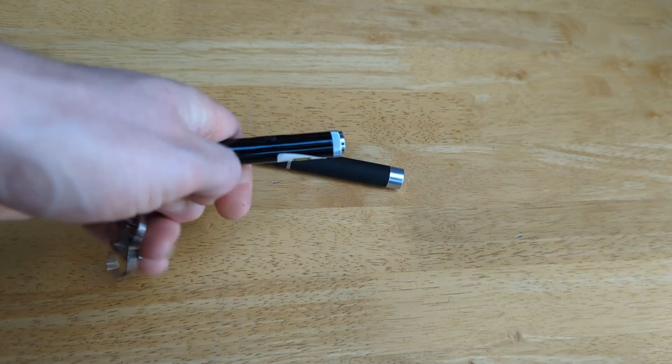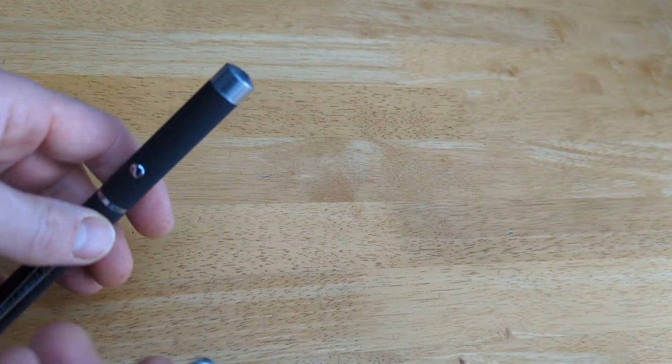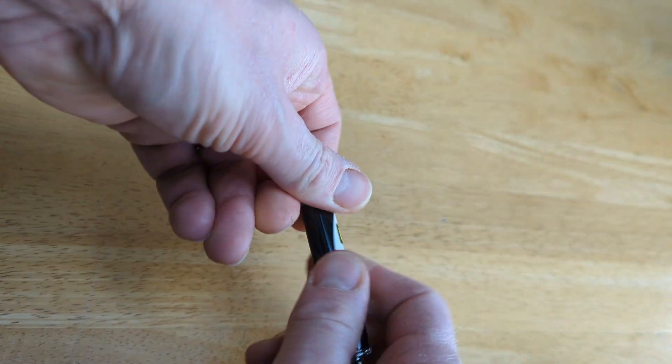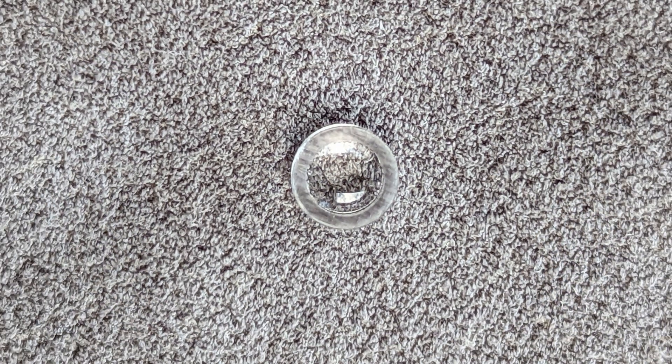One is an actual one I've been using for presentations; one is one I bought just for a bit of fun. Once I got them together and smashed one apart, I did actually find the little lens piece that they all talk about. And so I set about trying to assemble my smartphone microscope.